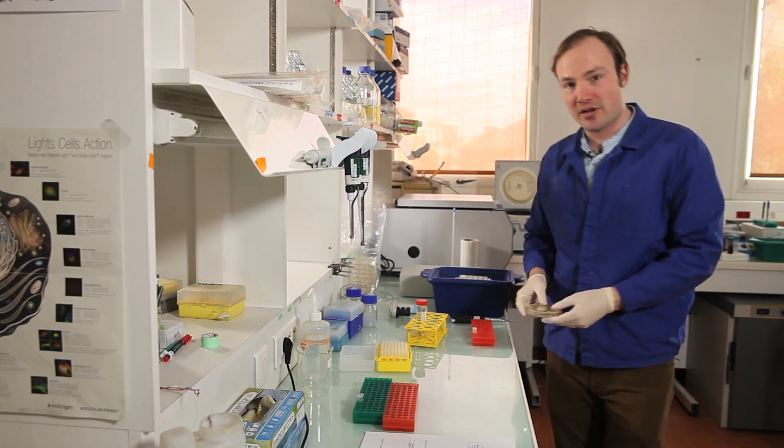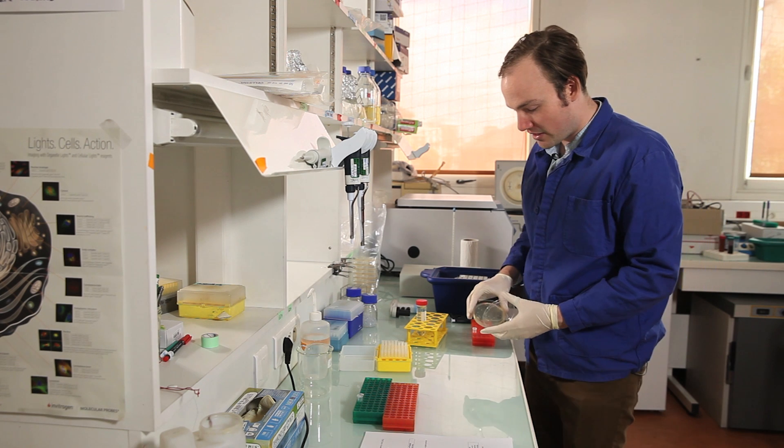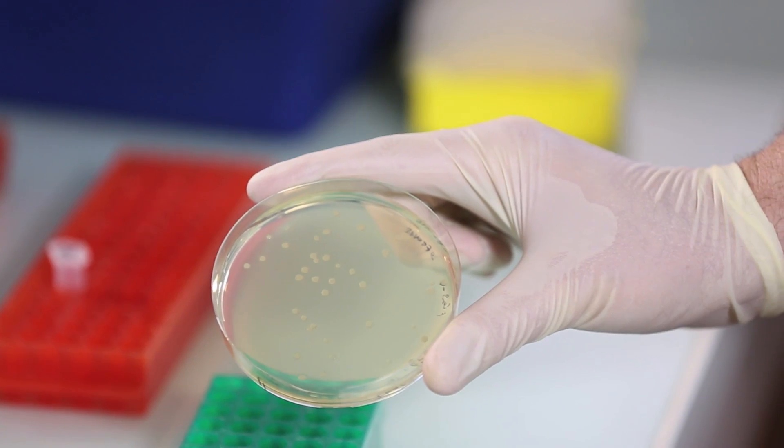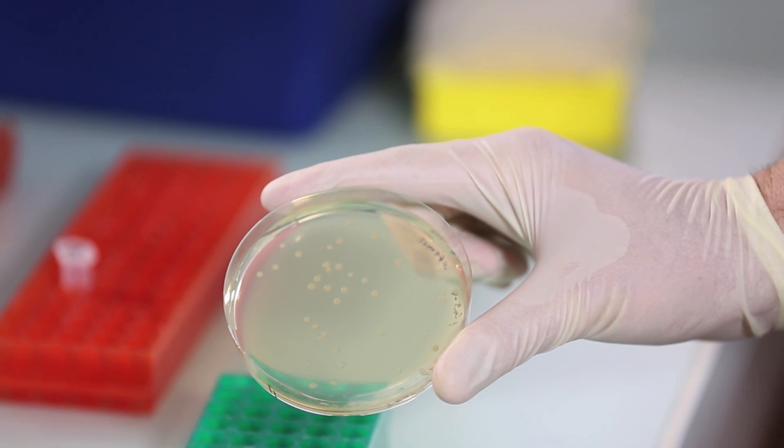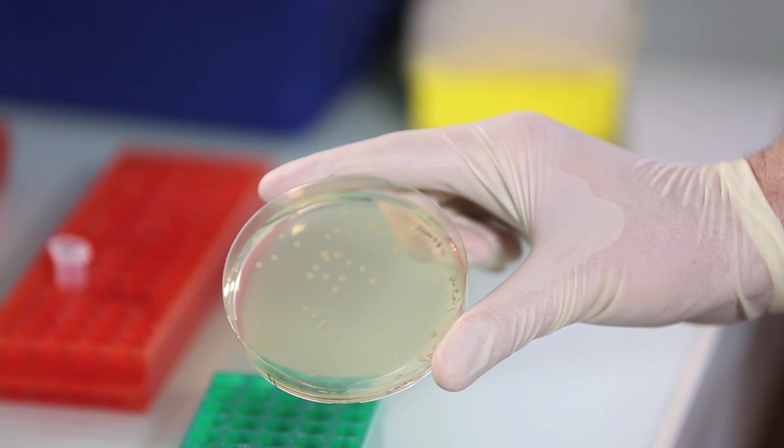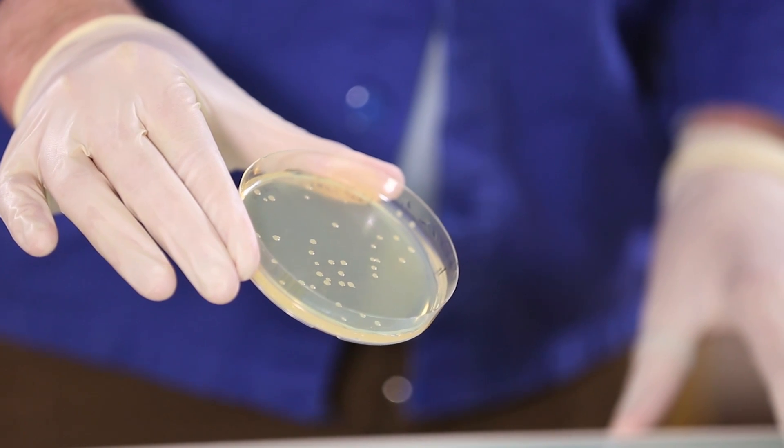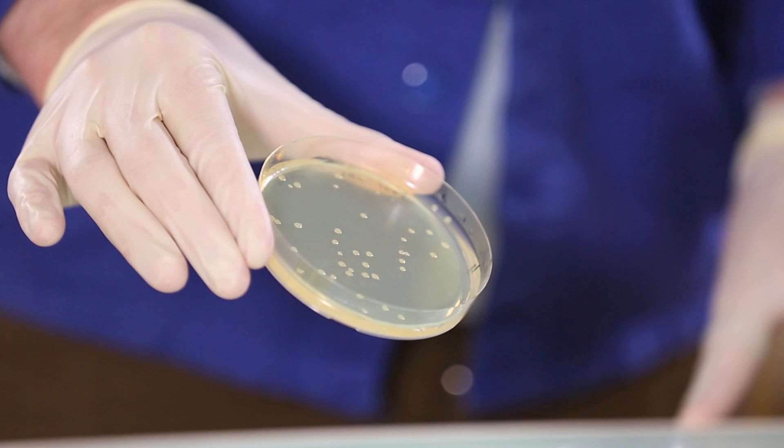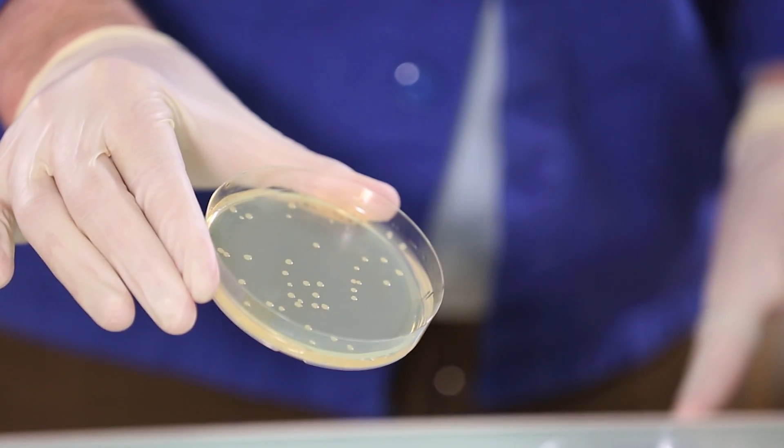So here I have an example plate that I prepared yesterday. And as you can see, this is after about 16 hours of growth. I have these nice beautifully formed colonies of transformed bacteria using the heat shock transformation protocol.